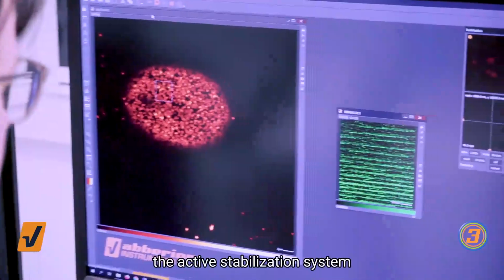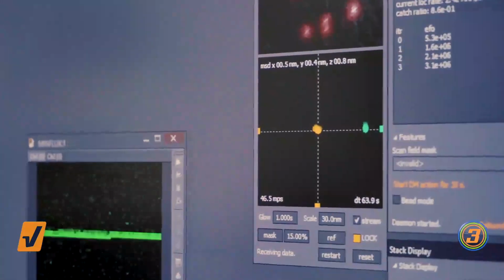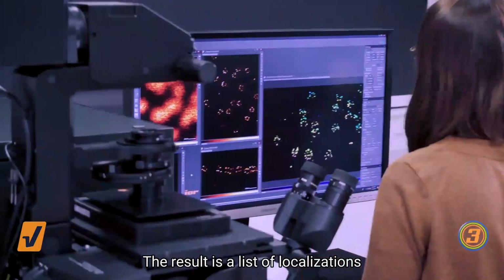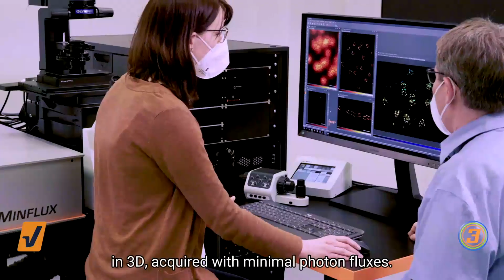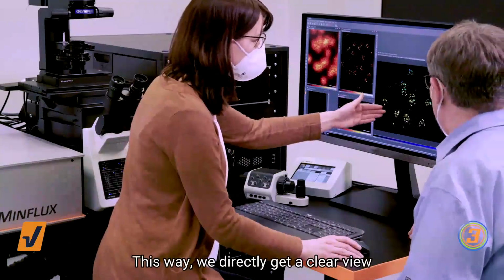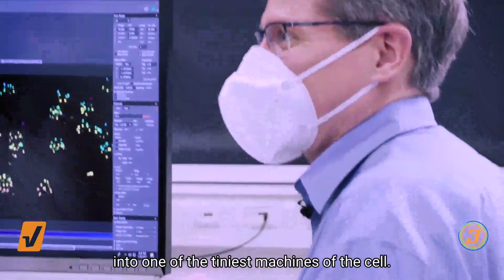During the measurement, the active stabilization system keeps the sample absolutely still. The result is a list of localizations with precisions better than 3 nanometers in 3D, acquired with minimal photon fluxes. This way, we directly get a clear view into one of the tiniest machines of the cell.